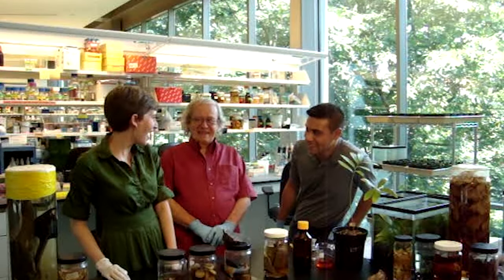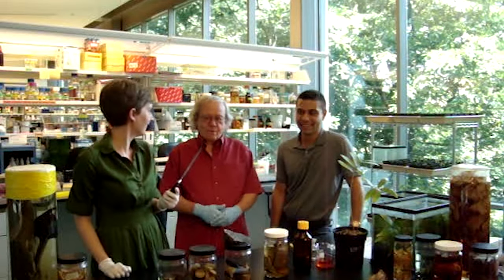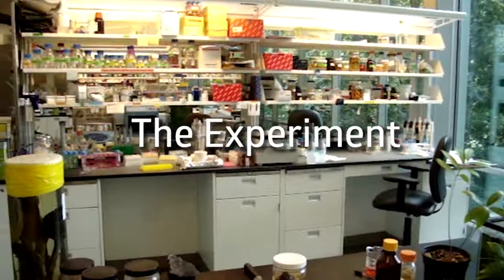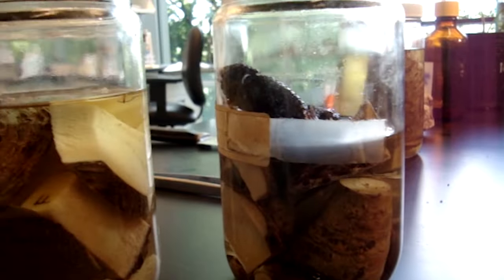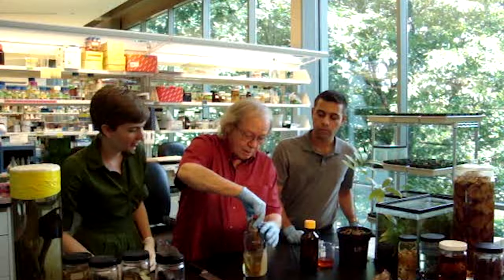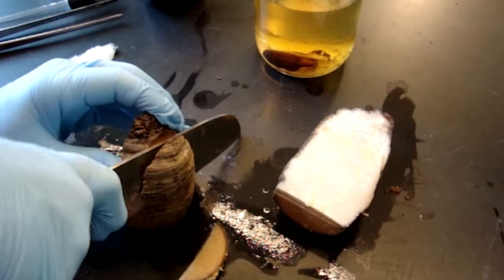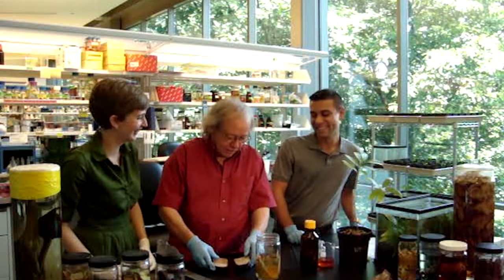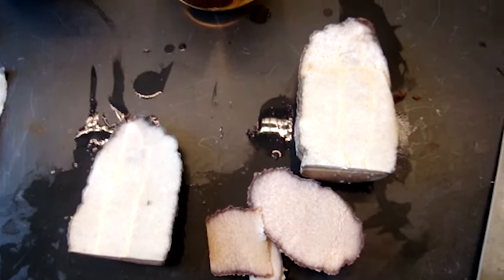So is it time to cut stuff? It's time to get out the giant butcher knife, which is totally a scientific instrument. And now we're going to do a slice-and-dice. I'm going to take a stem out of the jar here that's been preserved in alcohol, because often when we get a plant in the field, we bring it back so we can keep it forever and study it later. We cut it in half — sorry, Dario, I know you wanted to do that — and there we go. Now we can see the inside of the plant.